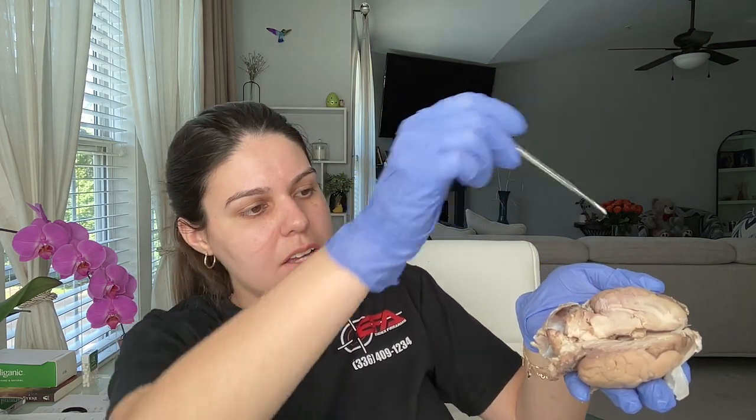here. Then we have the cerebral cortex, and the cerebral cortex is all of this area. And we have the white matter. I wanted to point out some of the white matter from the cerebellum, so we can see it right here. It's just that I relocated my camera. Like, it's right here, we can see the white matter, and lastly the meninges, and we have lots of them, so I'm just going to show you them. It's right here. So I think that is all of the structures that we were asked to locate in the sheep brain.